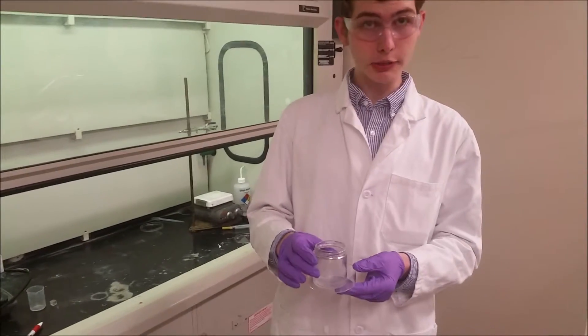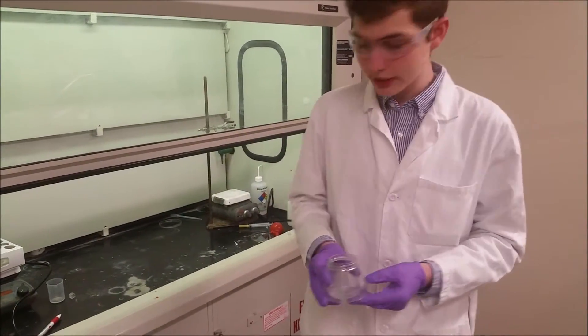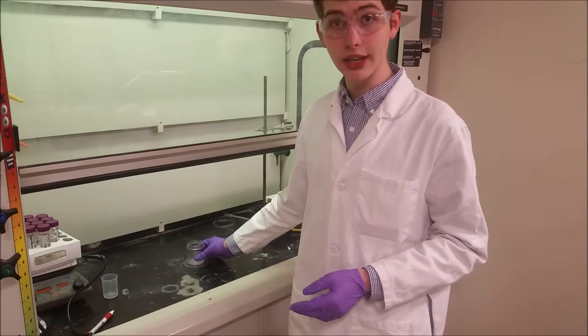This glass container is going to be in this petri dish in case it breaks, because we are going to be producing a lot of heat.